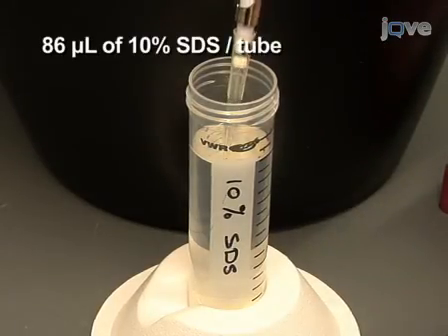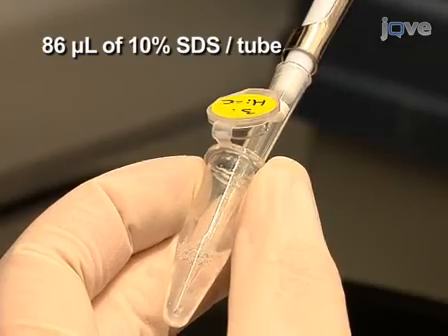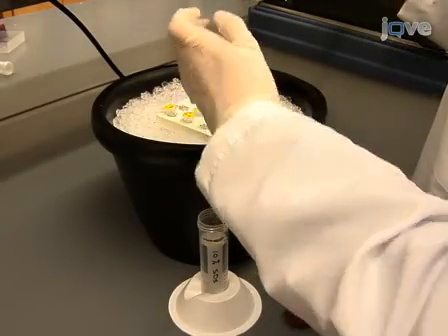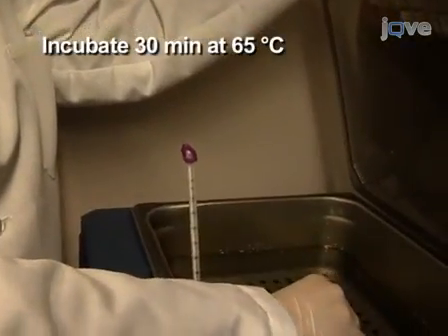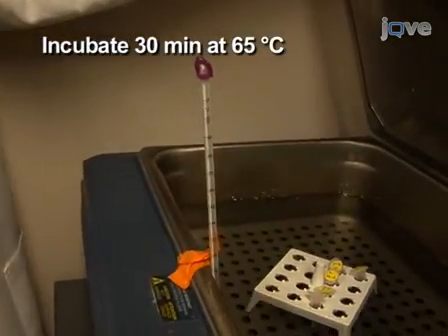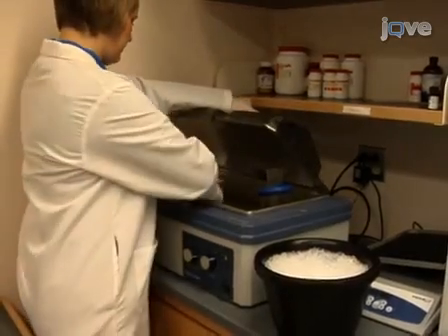Then, add 86 microliters of 10% SDS to all tubes to inactivate the enzymes. Incubate the tubes at 65 degrees Celsius for exactly 30 minutes and place them on ice immediately afterwards.